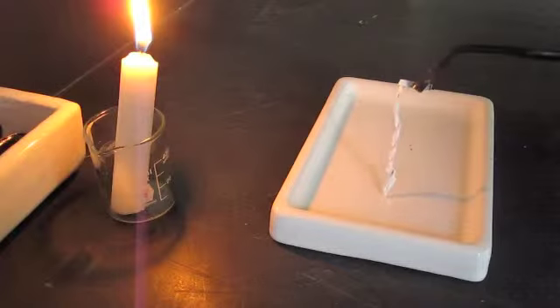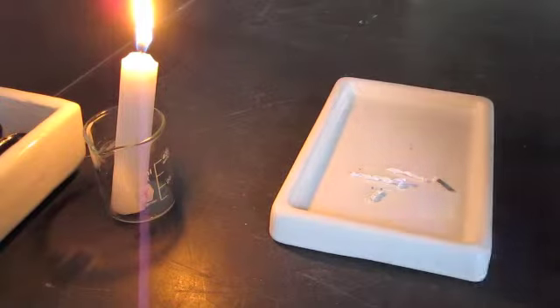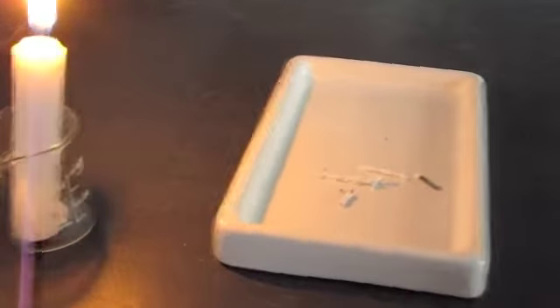And our reaction is finished. And you can see we're left with this magnesium oxide, which is a white powder-like substance. You can easily break this up into little pieces and crack it into powder.